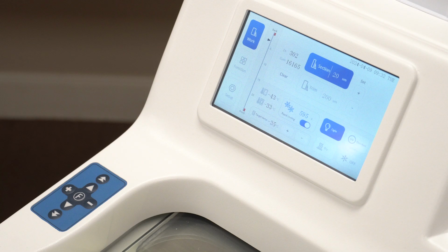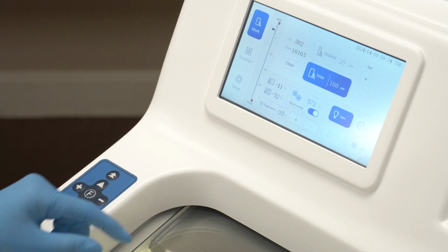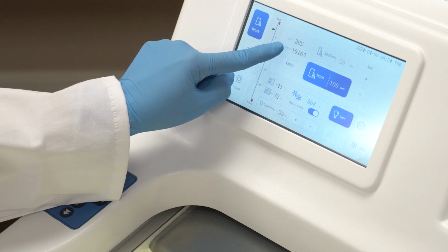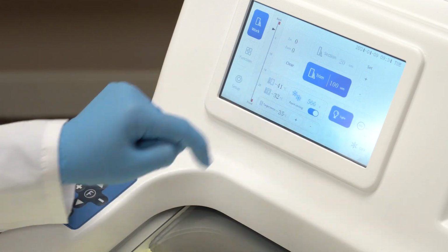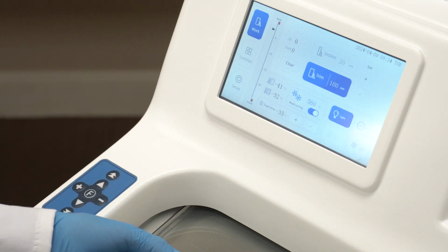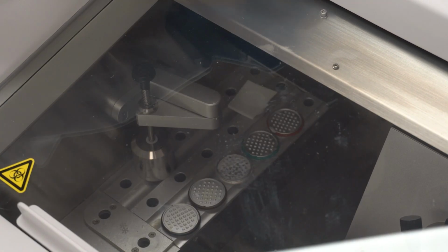Now, let's talk about trimming and sectioning settings. See the current slice thickness and trimming thickness, and make adjustments as needed. Keep track of your data using the keys provided, including the cumulative value of the number of slices and slice thickness. Press the reset button to erase all values. Light icon. This icon serves as a toggle switch for the light. Simply press it to turn the light on or off as needed.